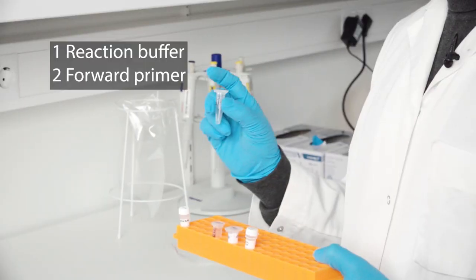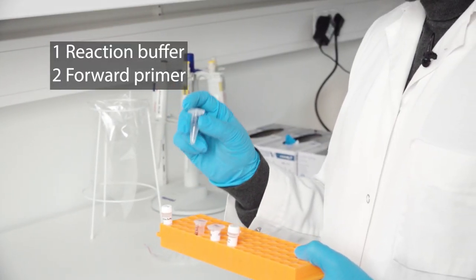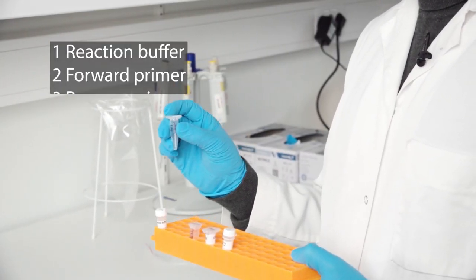Then we have the primers for the target we want to amplify, and we have a forward primer and a reverse primer.